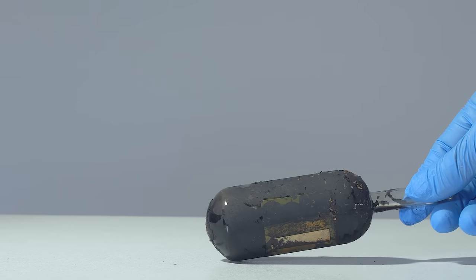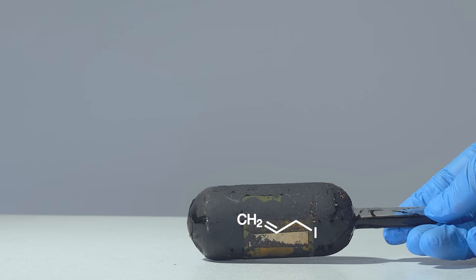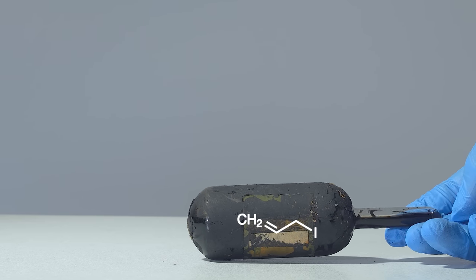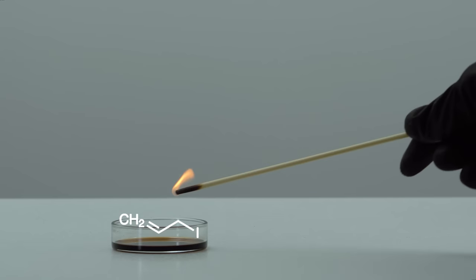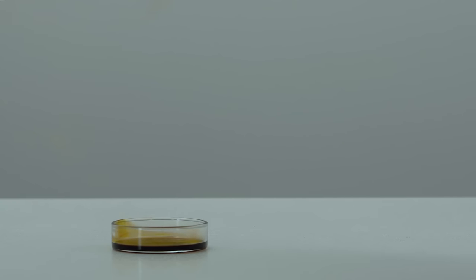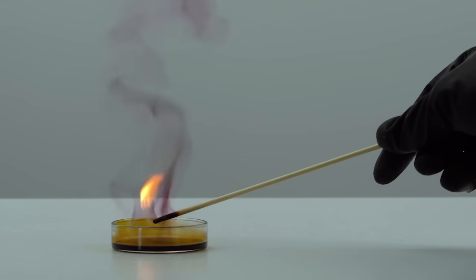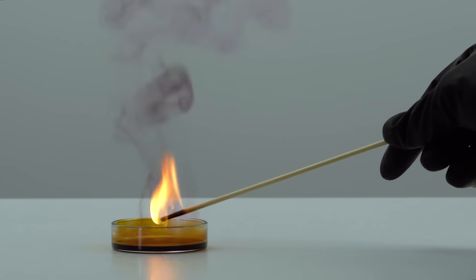But what happens with allyl iodide that contains even less iodine than the three previous reagents? Unlike previous non-combustible iodide alkanes, allyl iodide can be used to start a fire in the lab if you try hard enough.